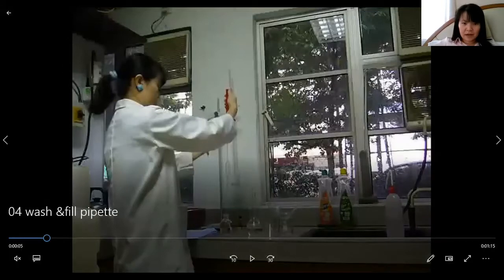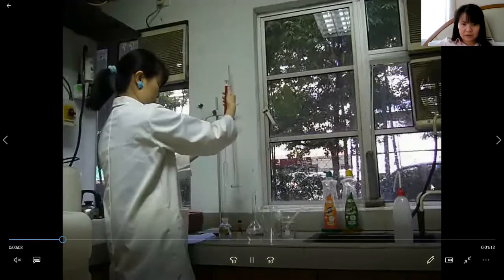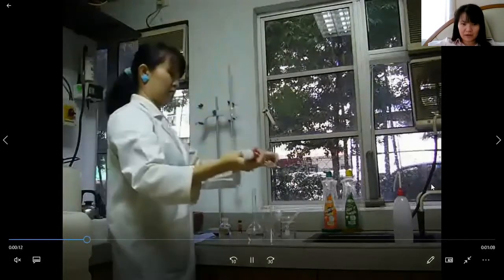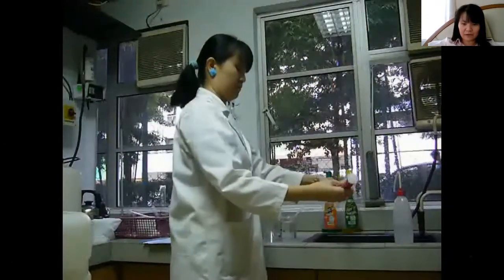Now using another pipette or wash the pipette from before, we're gonna fill in this pipette this time with the alkali. So I'm gonna rinse the pipette with the alkali first.